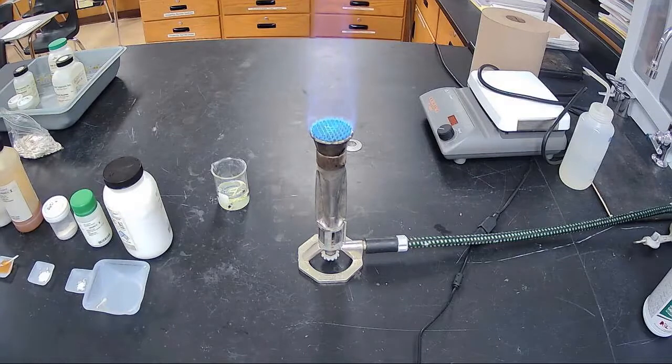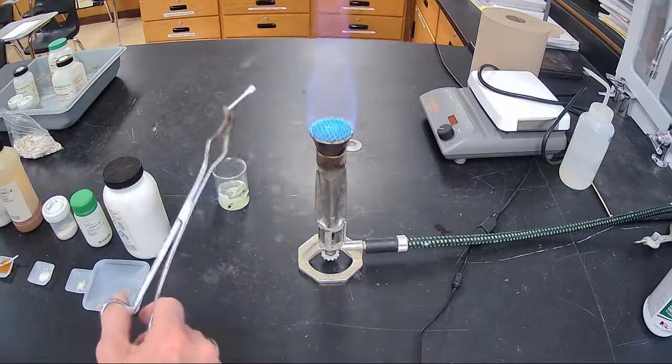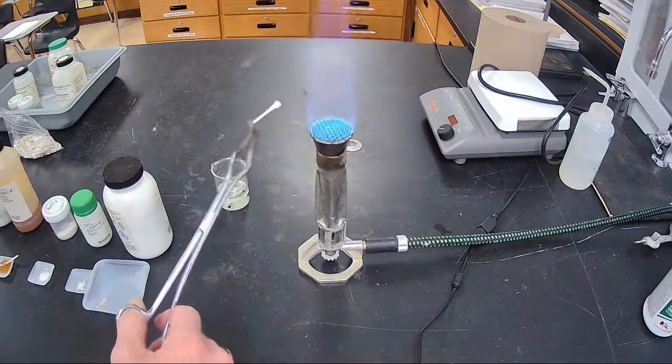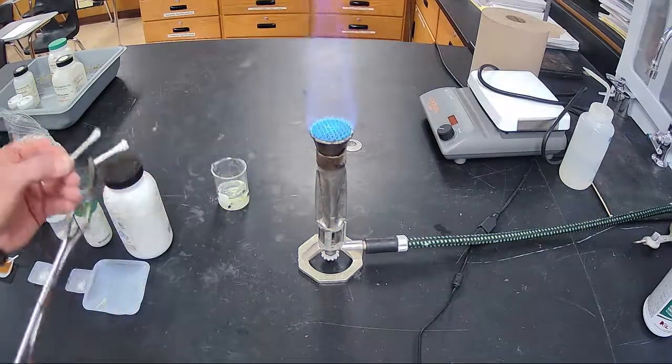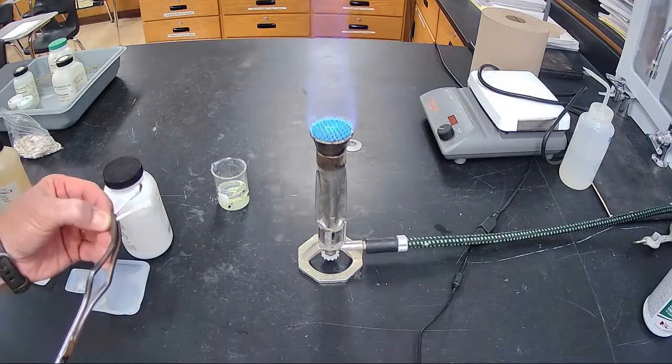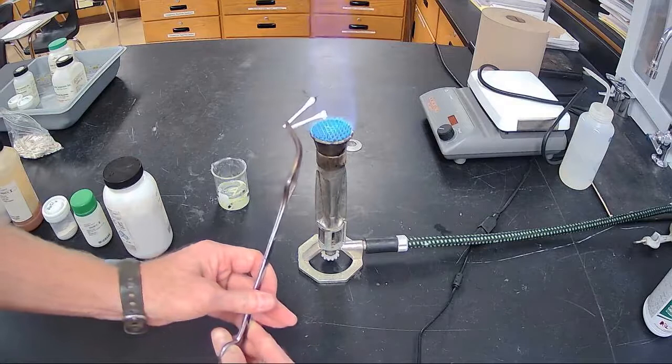I'm going to put right next to it salt number 3, because a lot of people think salt number 3 is orange. So you can see that color on the screen. I'm not sure how they show up, but here it looks like it's a yellowy orange. So if I put them together, you'll see the characteristic colors are different.